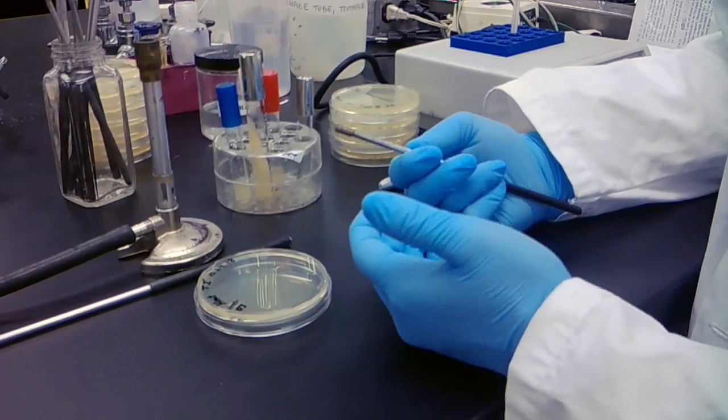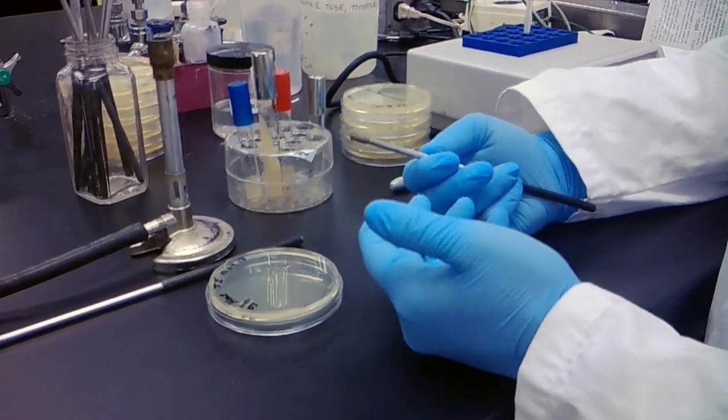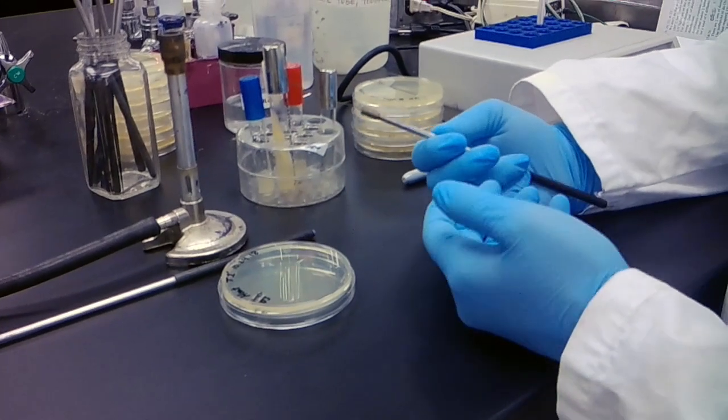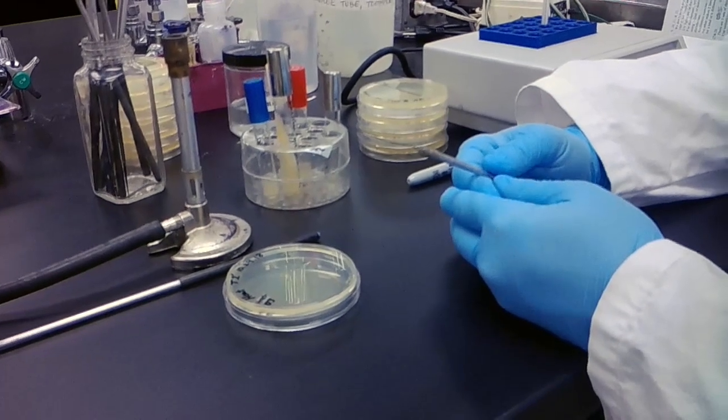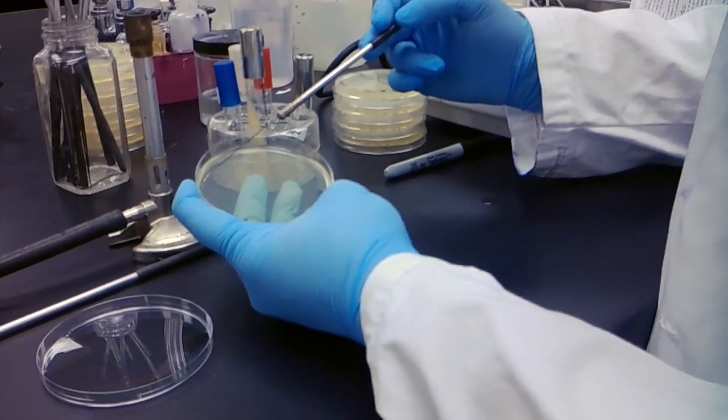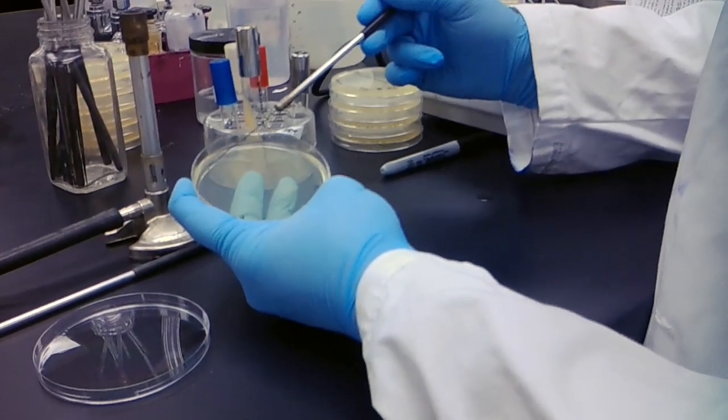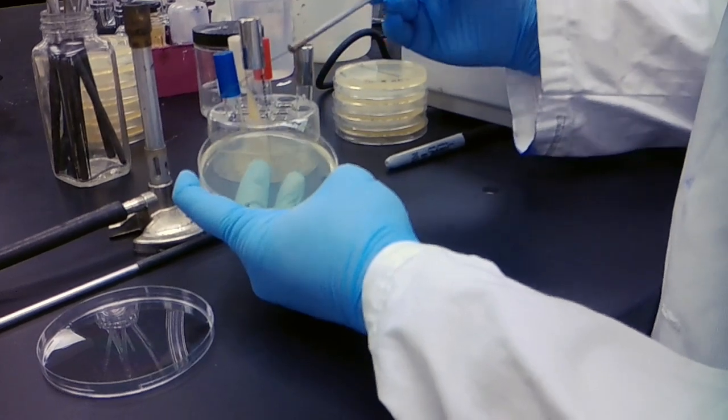What will be different is when we talk about the results between these plates. We should see a fair difference between all of them in growth. What I'm doing here is just making sure that my loop is cooled down enough before I go into my previous streak.